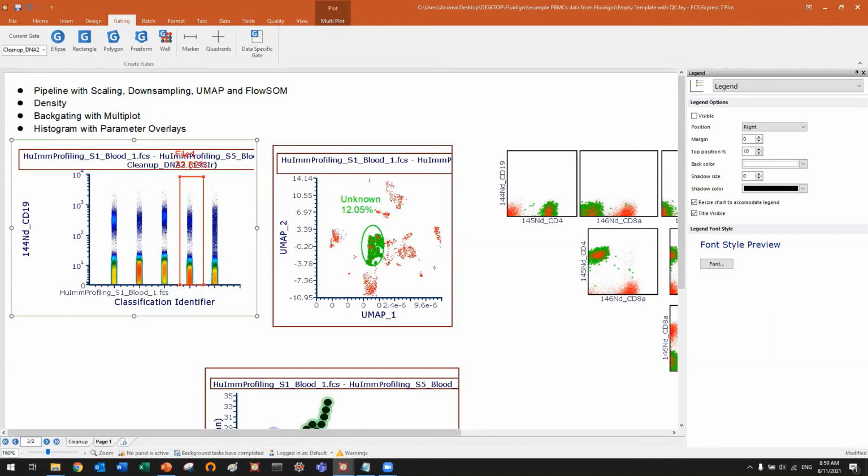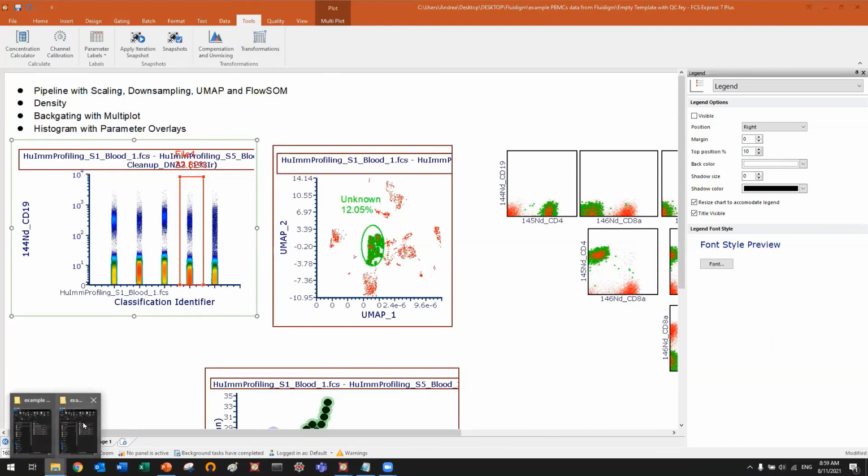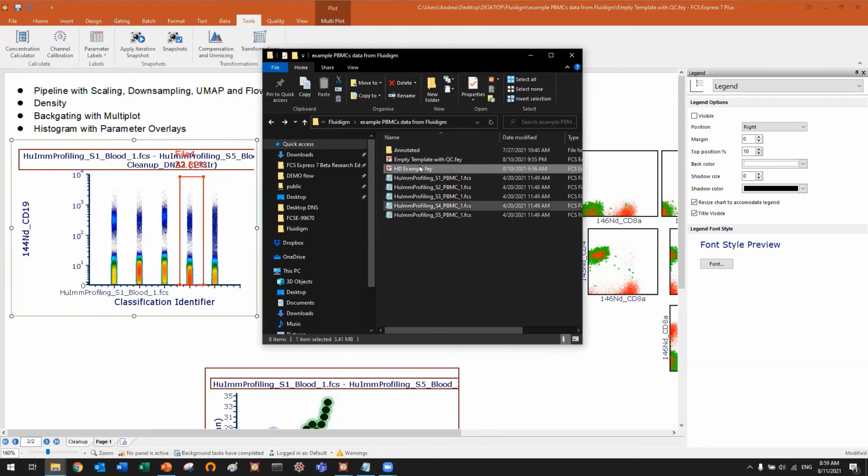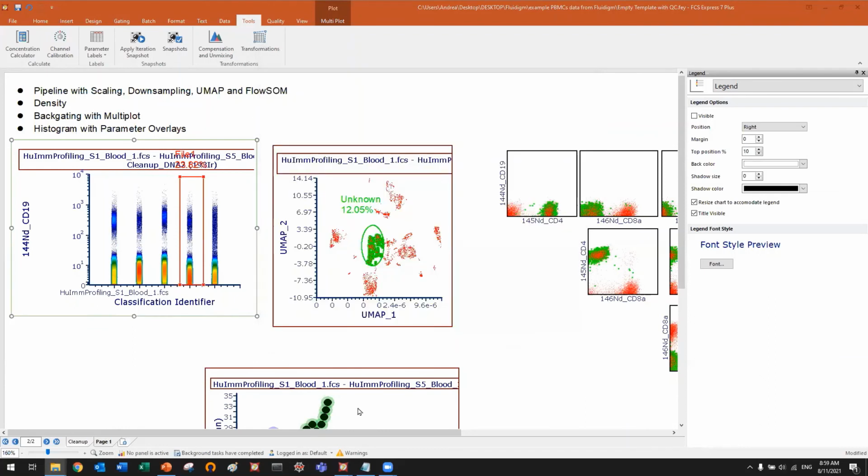So can I trace the parameter setting of each analysis after I get the results? There is no way to save all that information, like the pipeline, in an FCS file. The FCS format cannot handle that. So simply save your FCS Express layout. You save the FCS Express layout together with your FCS file. So for example, this is my folder. Where is it? Oh, here it is. You see, this is my folder, and I have my layout here together with my file. And every time I open it, I will see every setting.